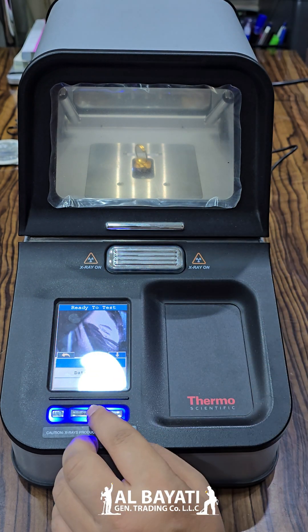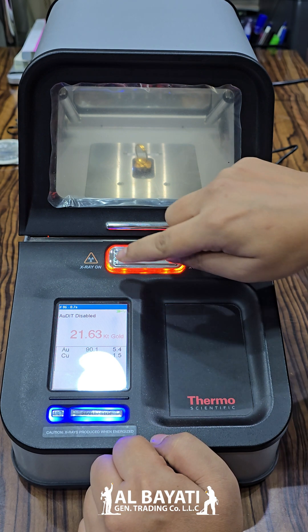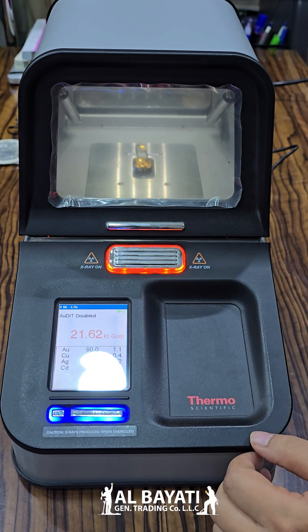Analysing. After you start the button, see — the light comes on. This is for analyzing. This light stops after a moment. This is ready.